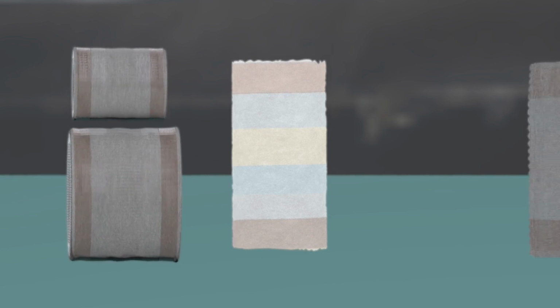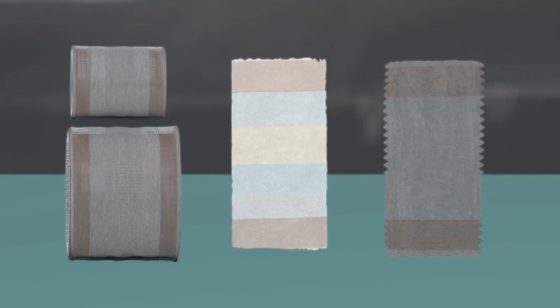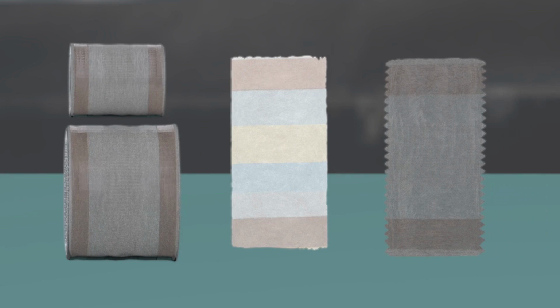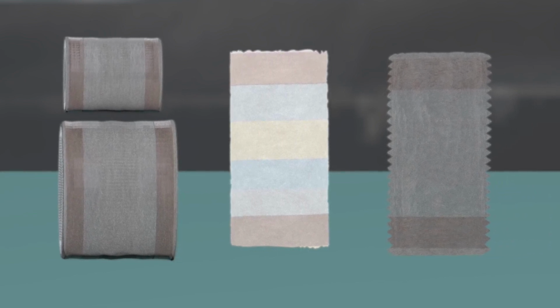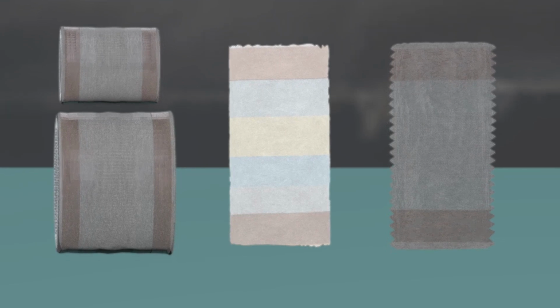Assessment for staining measures the transfer of colour from the original sample onto adjacent fabrics. While technicians can assess staining onto one single substrate, SDC's multi-fiber DW allows for quick and efficient testing of staining onto 6 different components simultaneously. SDC's multi-fiber DW comprises acetate, cotton, nylon, polyester, acrylic, and wool in one easy-to-use strip.